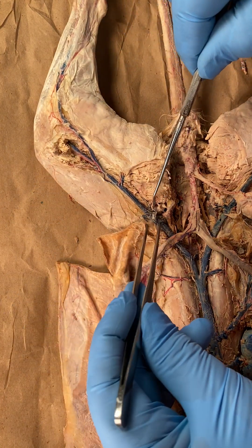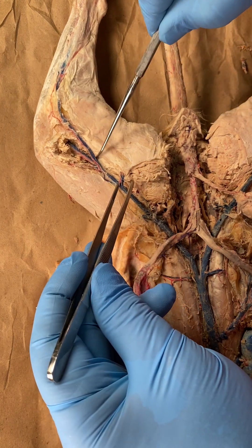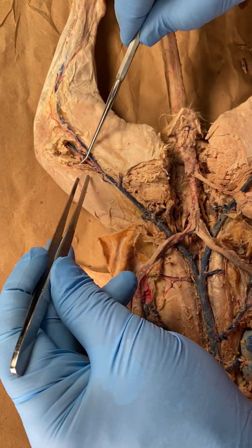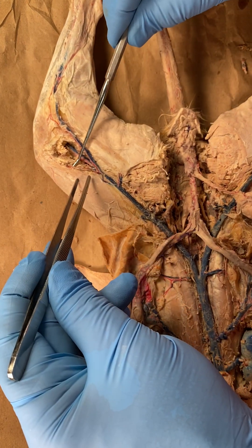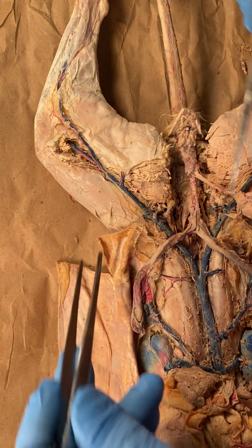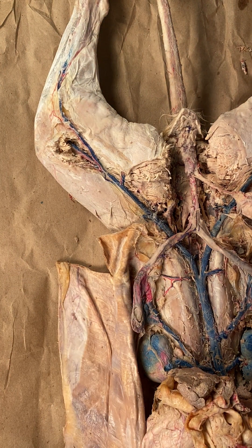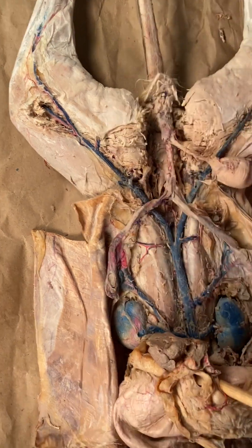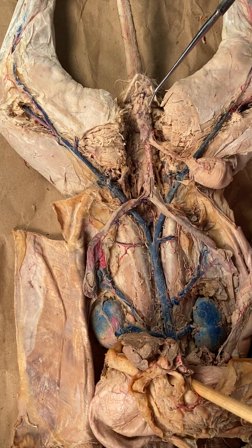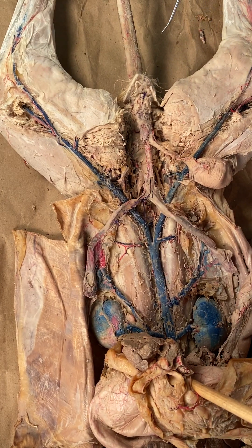Left external iliac, left femoral, left saphenous, left superior geniculate, and left popliteal. The right side didn't show up too well, so we're not going to do the right side on those. And there's your female reproductive system of the cat and the lower veins of the cat.